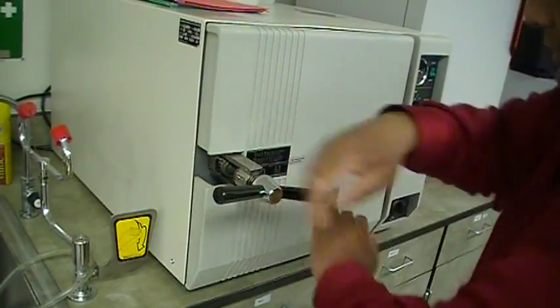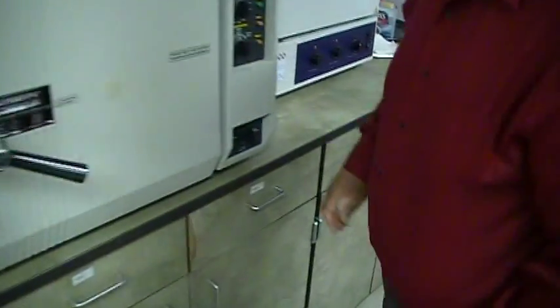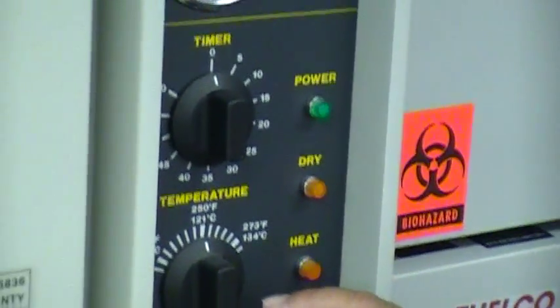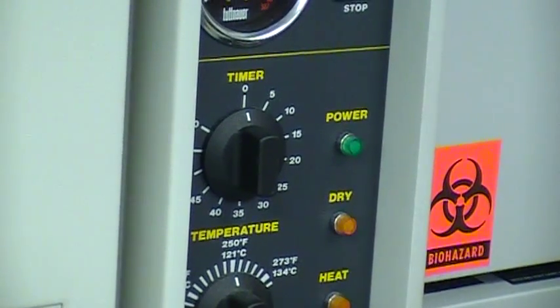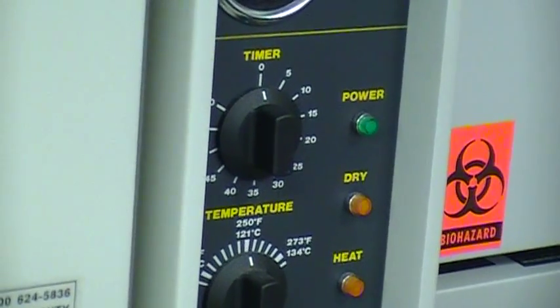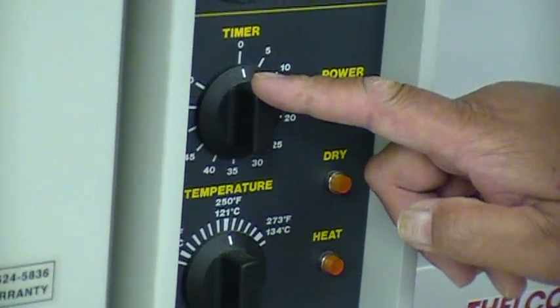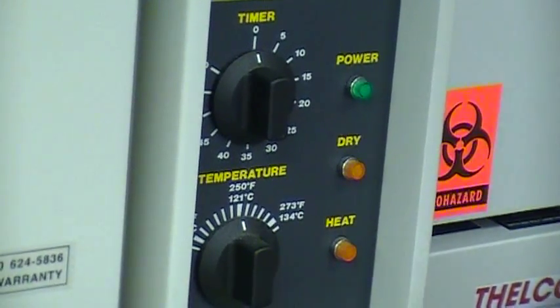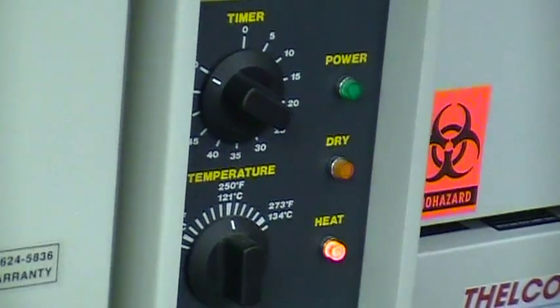To your right, until it's tight and snug, not too tight. If you're the first one to begin autoclaving early in the morning, and you need to autoclave for 15 minutes—most solutions will be sterilized at 121 degrees centigrade for 15 minutes—but if you're the first one to use this autoclave in the morning, you will turn it to about 55 to 60 minutes to allow the machine to warm up. So I'm going to turn this knob to 60 minutes and let it go.